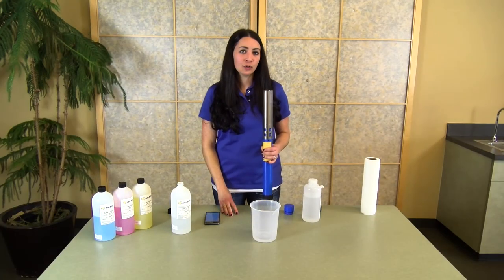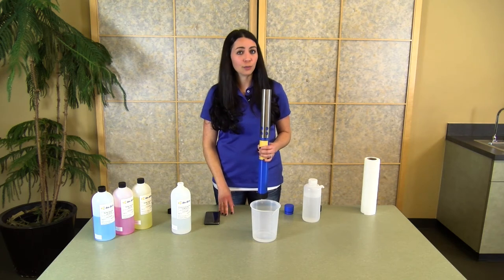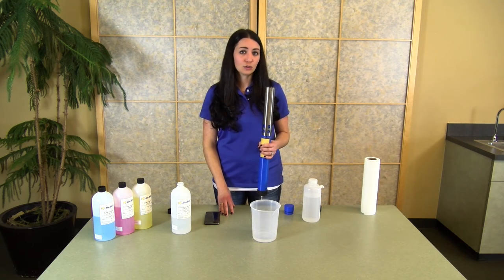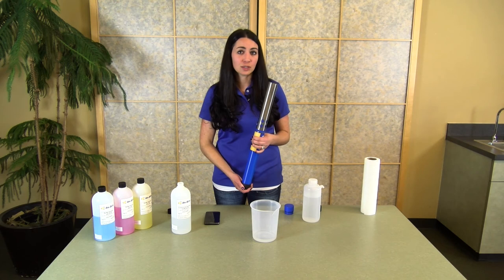If you are performing a multipoint calibration, follow the same rinse procedure, making sure you rinse with a little bit of DI water and then a little bit of your calibration solution prior to performing your second or third point. Even with multiple rinses, the amount of solution used is a fourth to an eighth of traditional methods, which will really save you a lot of money over a year of calibrations on the instrument.